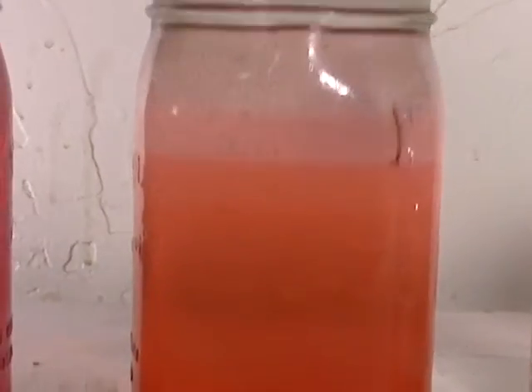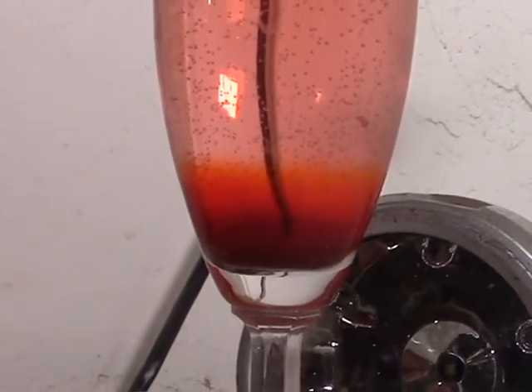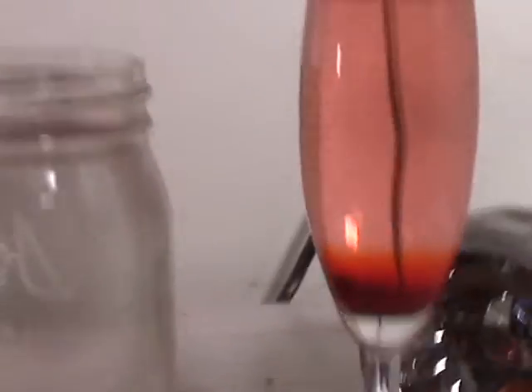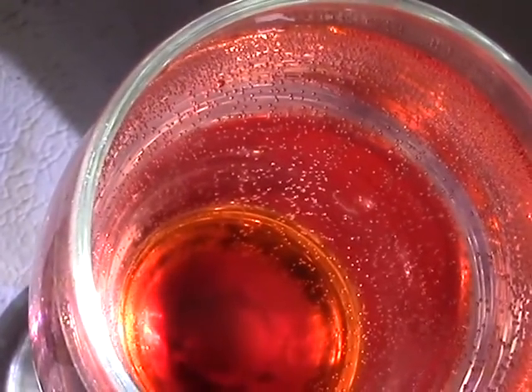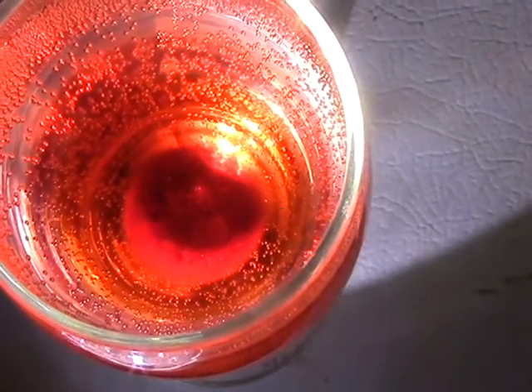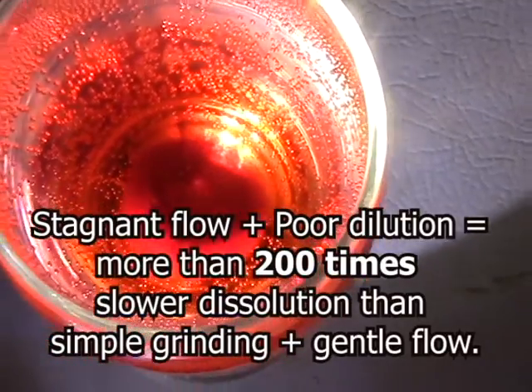Here it's a little bit more ambiguous. That one is still solid — you can still see a solid even though the average bulk solution is not very dark. It's still solid over two hours later. Here we are the next morning at about 6:45, and finally we've got almost all of the salt dissolved. So basically 12 hours under these circumstances before you get complete dissolution. You can see just how important the Nernst layer is and how affecting that dramatically changes the speed at which things dissolve.